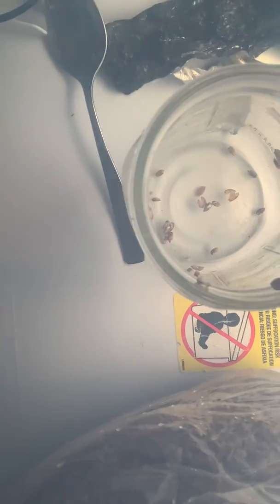Take your hands out, and there it is. Then you would just repeat the process for your other bags — I've got several here that I'm going to do. Take out the bag, and now you can see the grain is in there, and then I'm going to shake it, shake it, shake it. Shiitake takes quite a few months. This is my first run on shiitakes — I've been told about two or three months. So have patience, and magic happens. Bye, y'all!